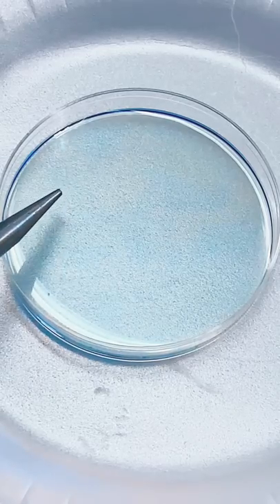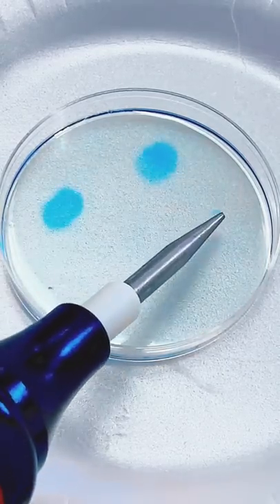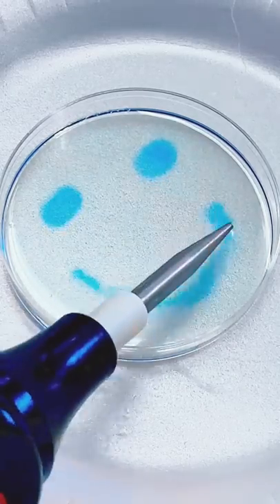to its blue form. In fact, it's so good at doing this that you can use the ozone gas generated to draw pictures in a controlled fashion in the blue bottle solution.